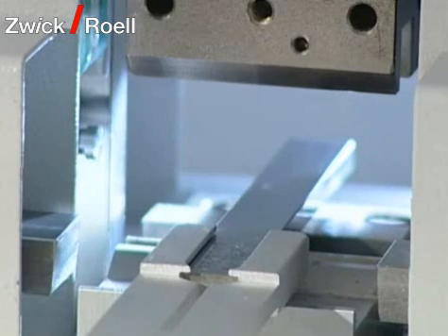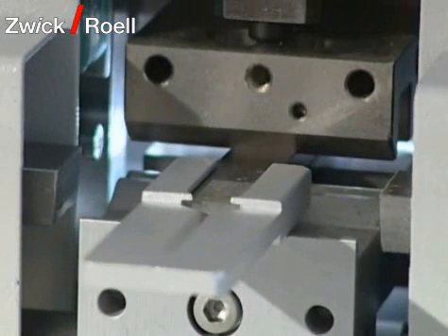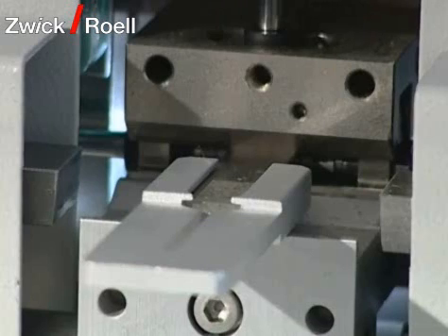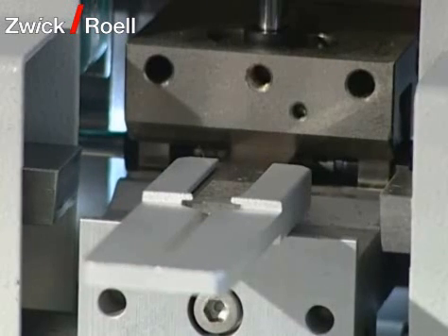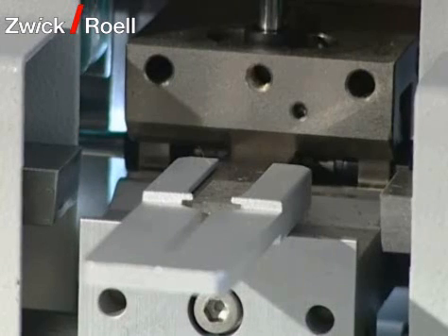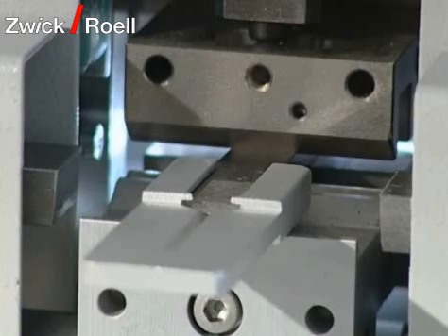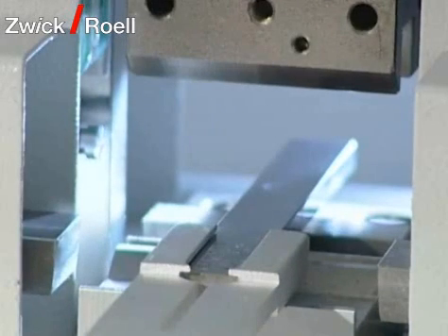Both when starting the system and after a predetermined number of specimens, a reference measurement with a calibration block is carried out with the cross section measuring device. The robot takes the calibration block out of its deposit and transports it to the cross section measuring device. Then three reference measurements are carried out which are then compared with the certificate of the calibration block.